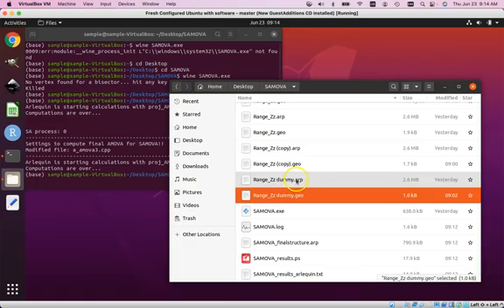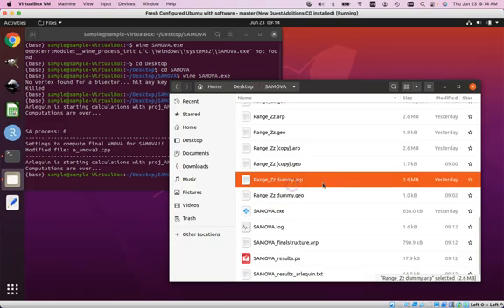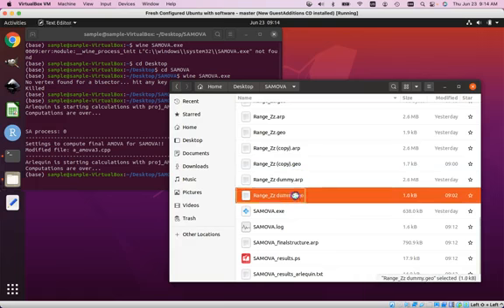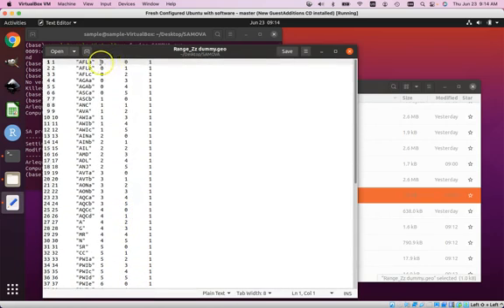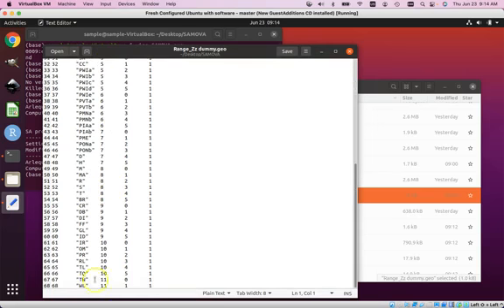So to troubleshoot, one thing that I did is I created dummy GPS coordinates. So this is his full data set, specimens numbers 1 through 68. And here are his GPS coordinate columns. This is longitude, this is latitude. Rather than using real longitude and latitude data, I put in dummy data. So each one of these individuals has a unique coordinate.